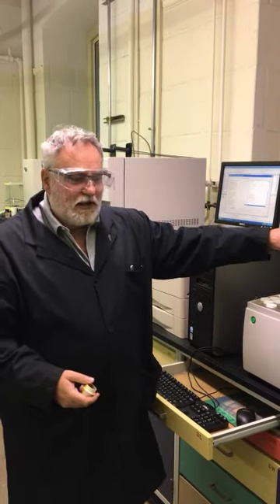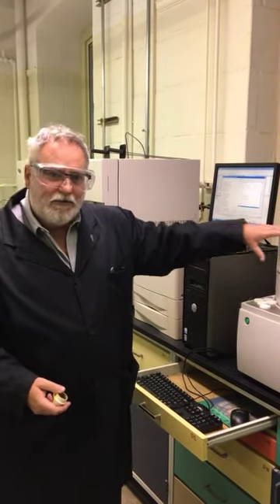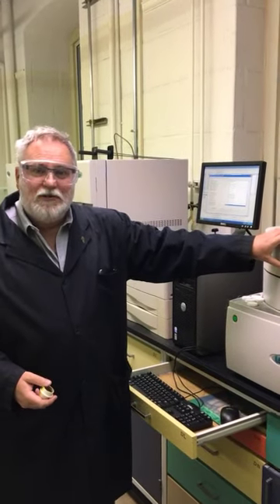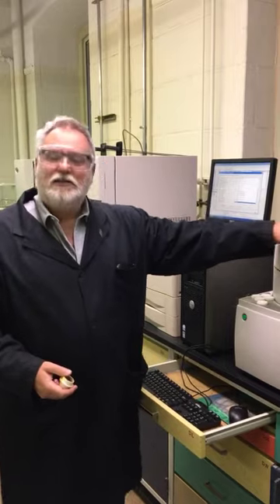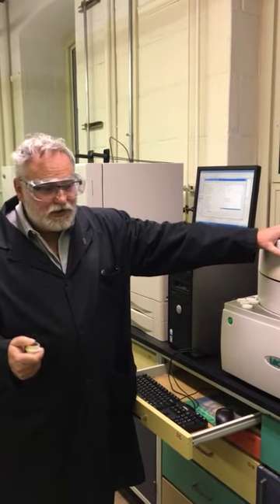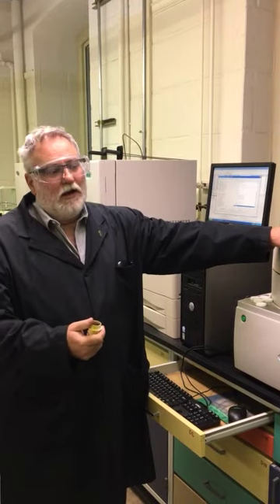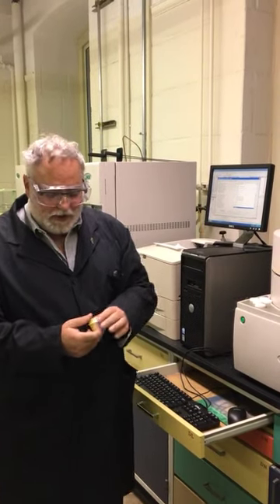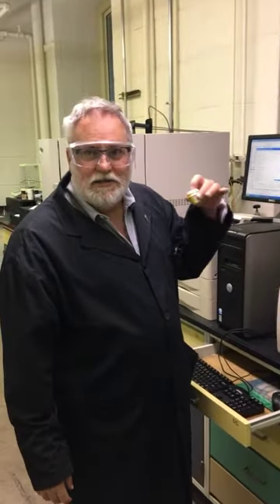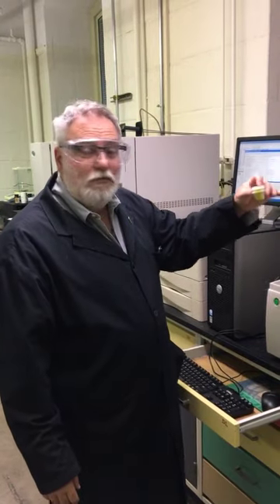During this time, it's an inert atmosphere. We have nitrogen gas flowing through, and again, read the ASTM, you'll see that it has to exchange the volumes a certain number of times per minute. After the moisture step has been recorded, the lid opens and we place the cover on the crucible. It goes around again and reweighs the new mass.